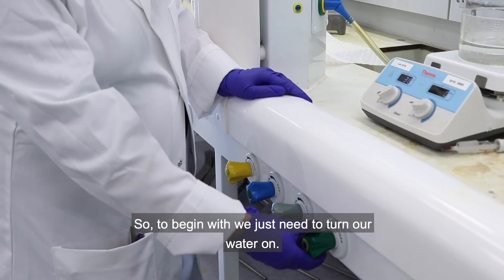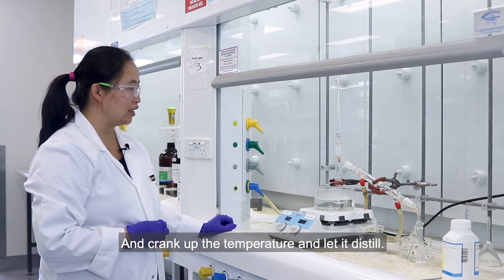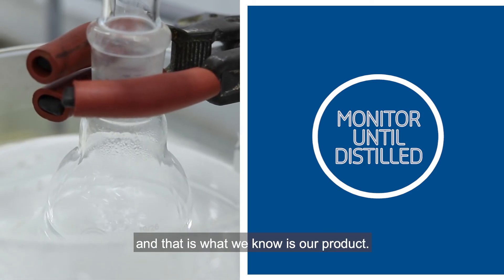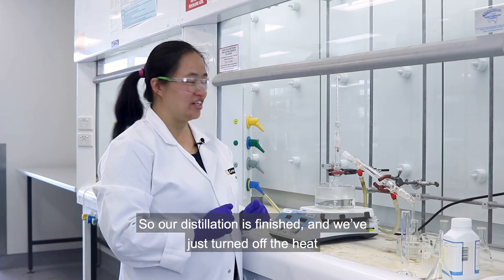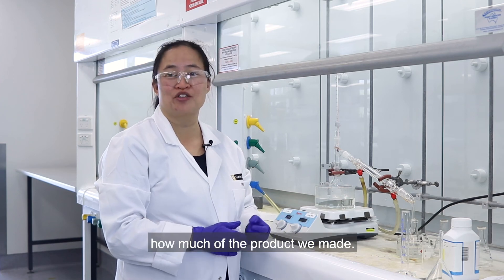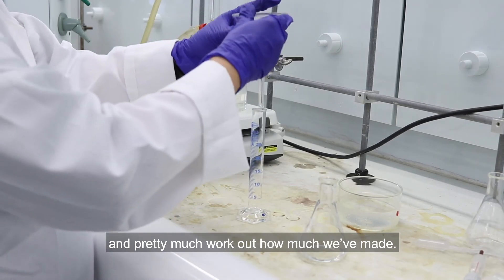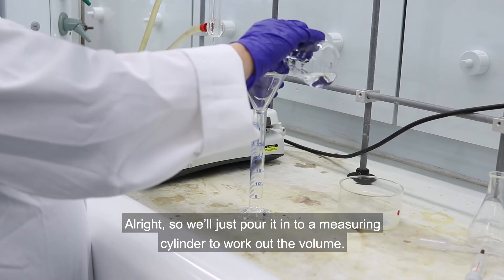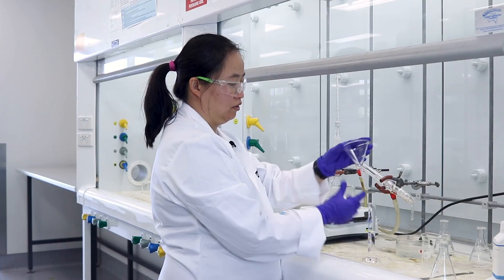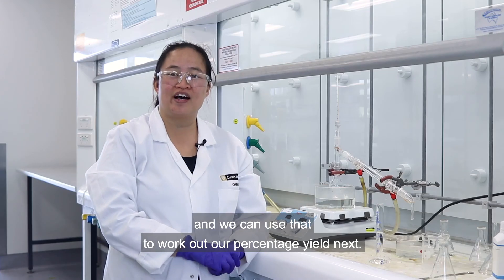To begin with we just need to turn our water on. Water's on — crank up the temperature and let it distill. We're only going to collect the fraction that is below 80 degrees, and that is what we know is our product. So our distillation's finished and we've just turned off the heat. The last thing we have to do is work out how much of the product we made. We just pour our collected distillate from our conical flask into a measuring cylinder to work out the volume. And we've made about 17.5 ml, and we can use that to work out our percentage yield next.